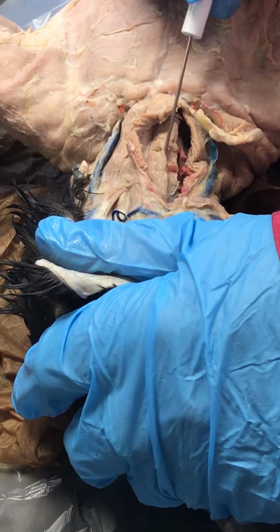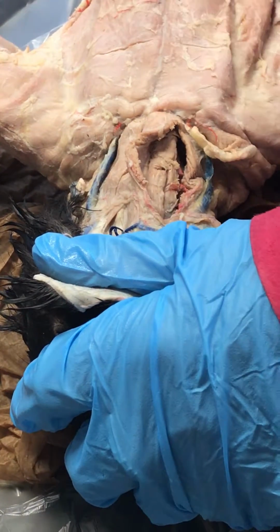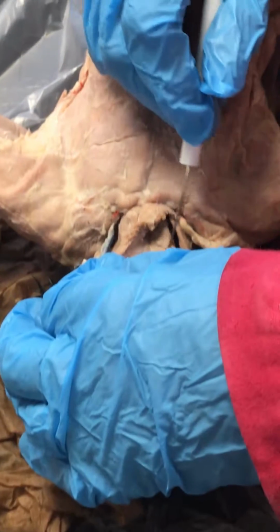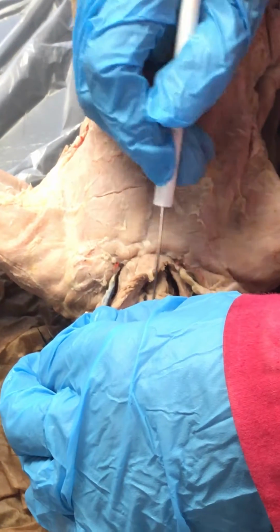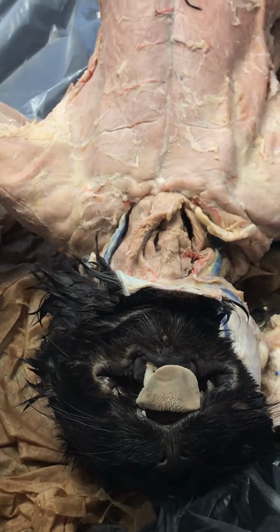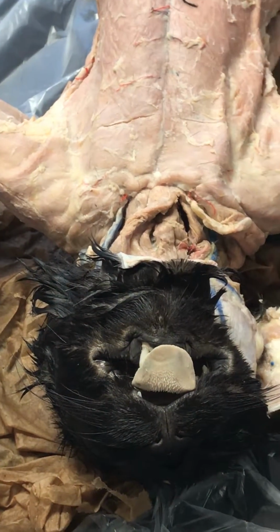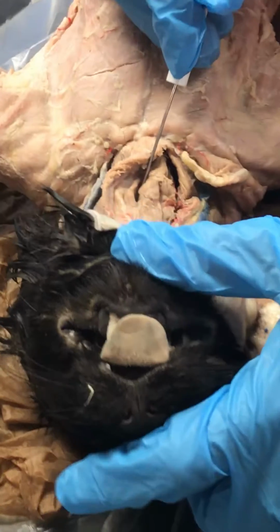Sternohyoid, directly on top of the trachea. This muscle sits right on top of the trachea. The trachea is right here, the windpipe. The sternohyoid is there, and then the sternothyroid is actually going to be right off to the side of your sternohyoid, and that's your sternothyroid. So you guys try to remember, your hyoid bone sits right above on top of your trachea. So that's why the sternohyoid is the muscle right on the trachea. You have 2 thyroid glands on each side of your trachea. So the sternothyroid is off to the side of the trachea.